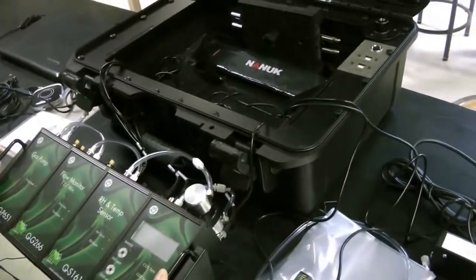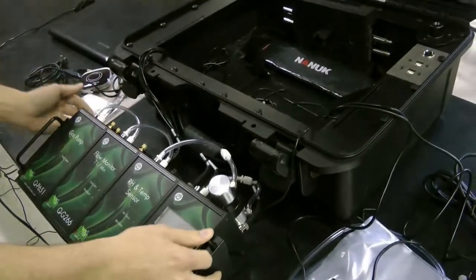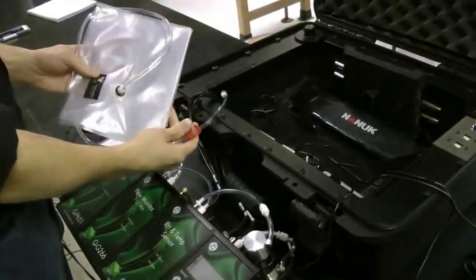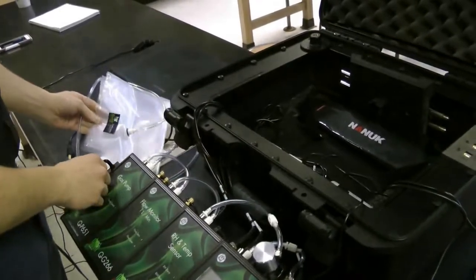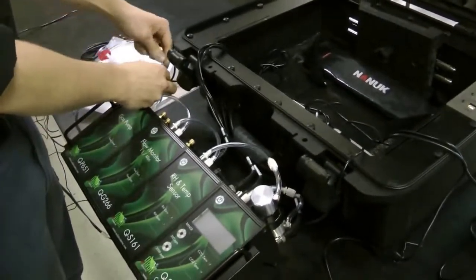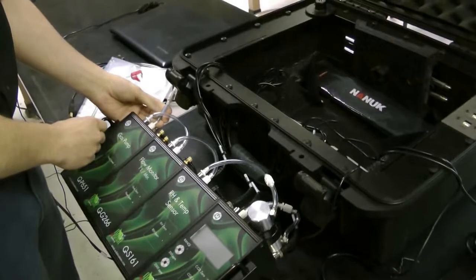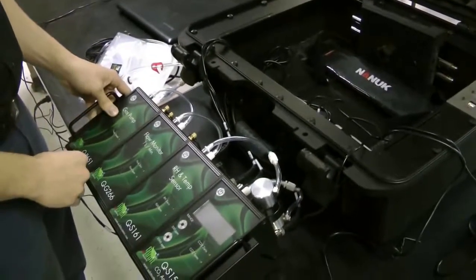Looking at your sensor tray, we have the gas pump, which pulls in through its input and a particulate filter. This particulate filter on the input connects to your gas bag, which is included in the QBox. This gas bag is used for your analysis and testing. When attaching the gas bag, attach it to the particulate filter. The filter is used to scrub out any dust particles which might affect the gas pump.